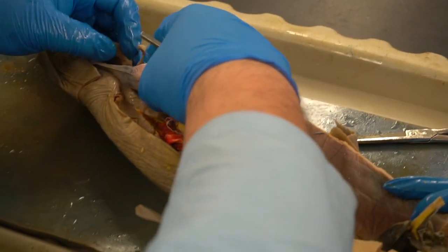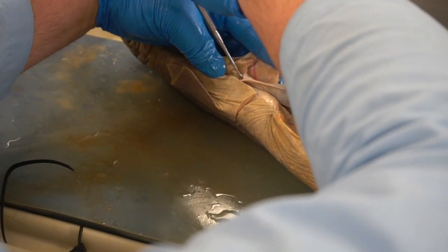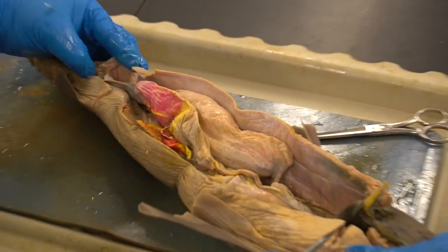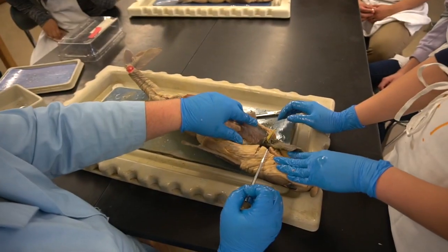Okay, that area is called the rectum. The rectum is at the end of the line here, and the opening right at the end is the anus, and that dumps out. So you've gone on a tour of the digestive system from top to bottom. You can apply that as you see it on your specimen. Is everyone good with digestion? Everyone good with the heart and that part of the circulation?